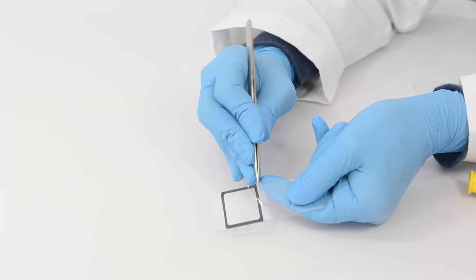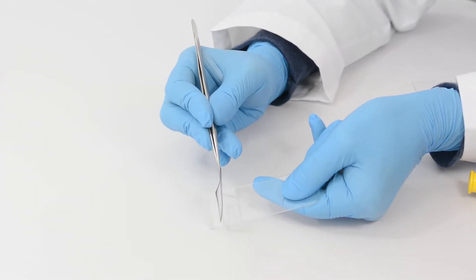The chamber can be easily removed without leaving residue on the slide.